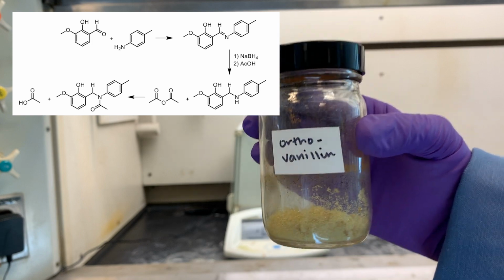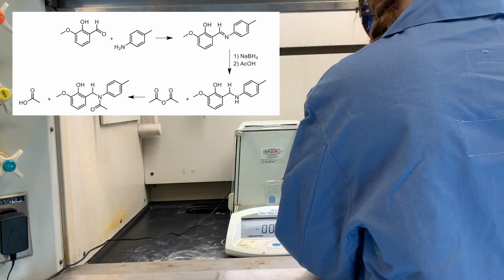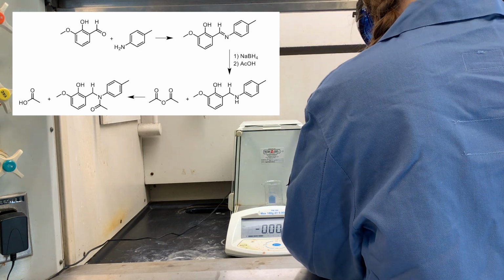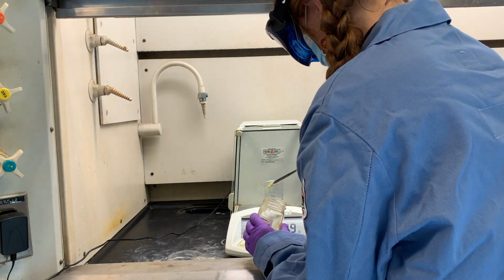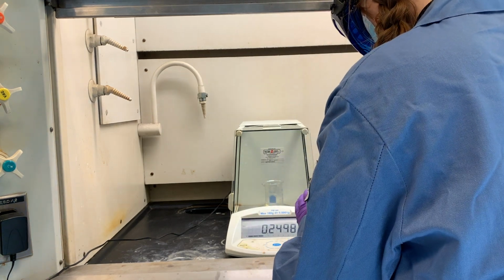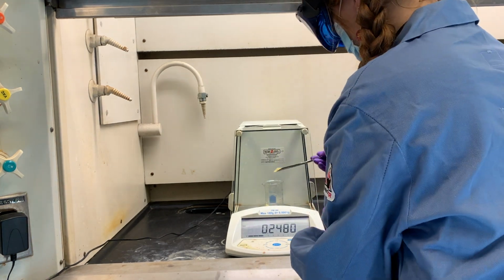In today's reaction, a primary amine will be converted to a secondary amine via reductive amination, and the secondary amine will be acylated to form our final product. We are not forming a chiral center in today's experiment because we are using an unselective reagent, sodium borohydride.